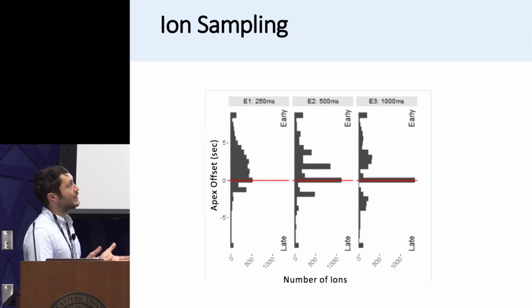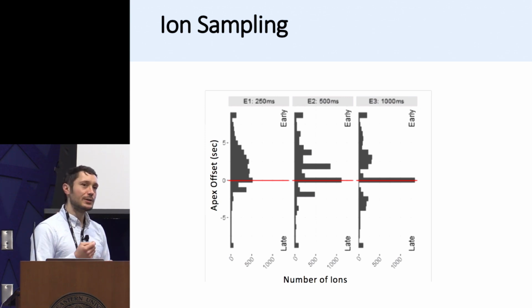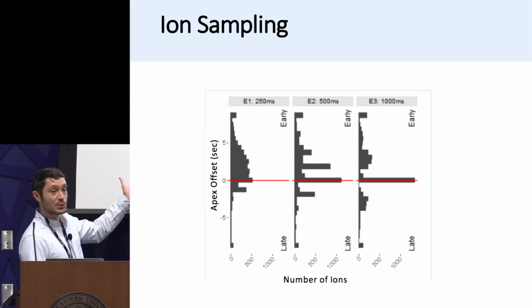So we reasoned that maybe there's a way that, keeping most parameters the same other than MS2 injection time, we could potentially begin to sample closer at or near the apex of the elution profile. And so we reasoned that by expanding this collection window, the MS2 fill time, we could bias ourselves towards this. In essence, just waiting a little bit longer to sample the ions of interest. And you can see that this worked.